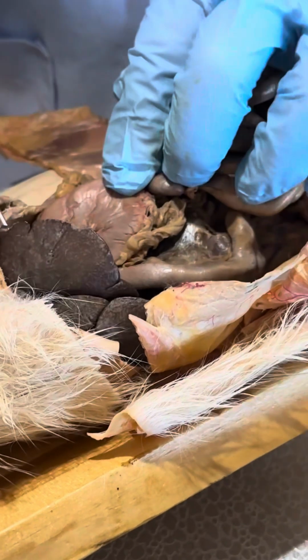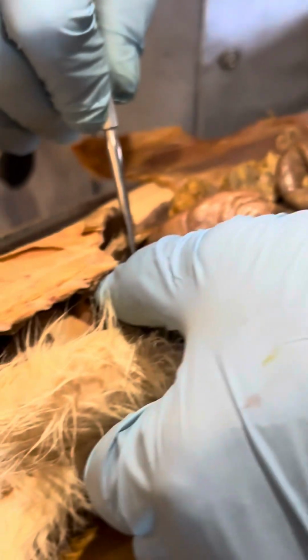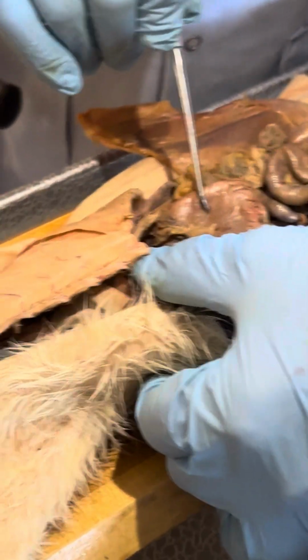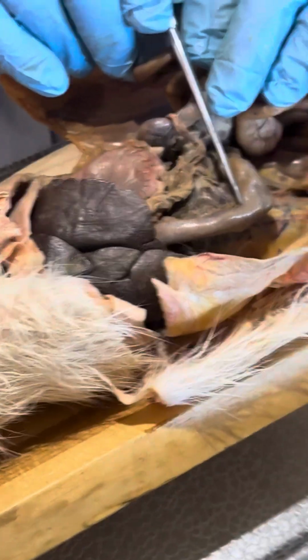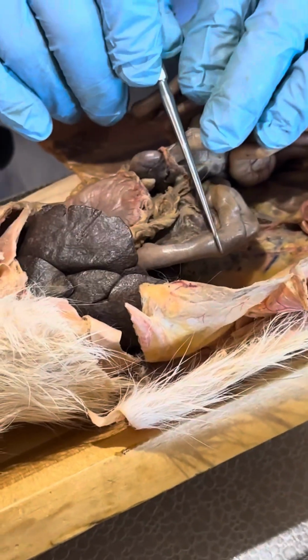there. Okay, then coming down, we're going to have the esophagus, and then we're going to have the stomach-shaped organ. What's the stomach-shaped organ? Probably the stomach. Oh my God, Leah, you're on fire. Coming out of the stomach is going to be the straight tube that goes craniocaudal. That would be the duodenum.